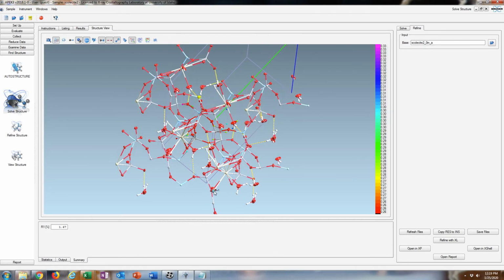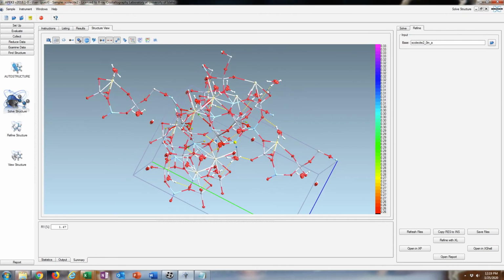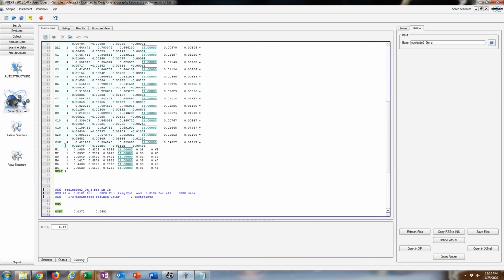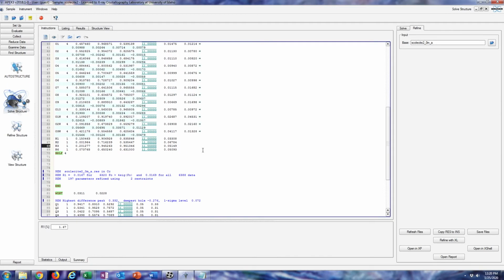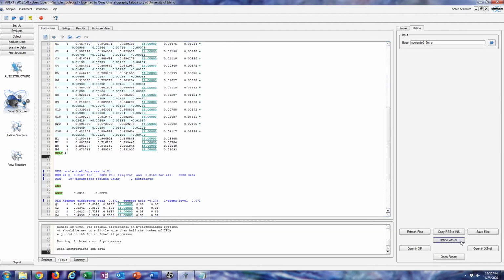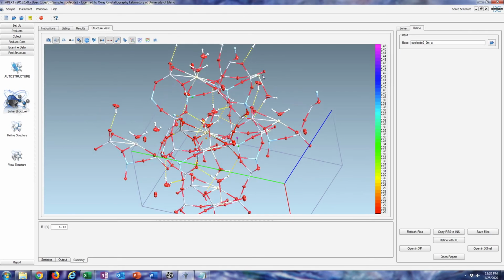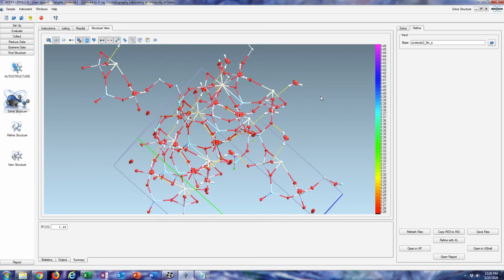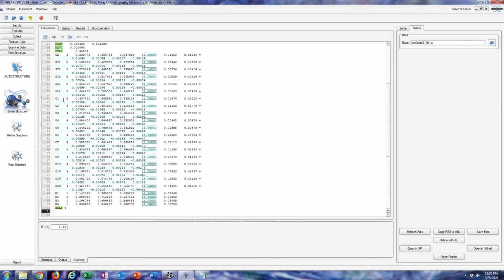In chemistry, you'll find that you have to put all sorts of constraints on these to make them work, but also to make sense in your model. But these are behaving pretty well, even though the bond distances are probably wrong. But yeah, I think 4 and 5, those don't make sense. Those are not correct. There probably are 6 hydrogens, but these two are not the actual hydrogens. So I'm going to refine it without those two, since it's so stable. If it's not stable, you'll have to put restraints on those, and you can look that up on the ShelX commands list. Yeah, so now Q1 and Q2, those are probably the hydrogens we're looking for.